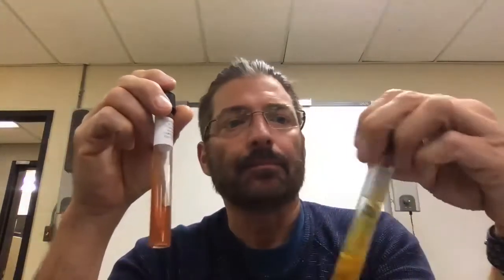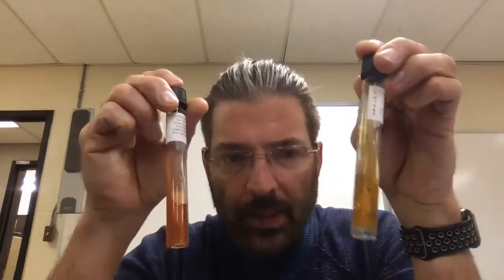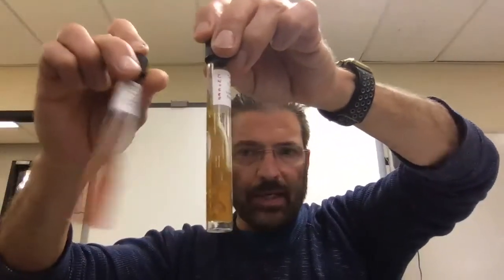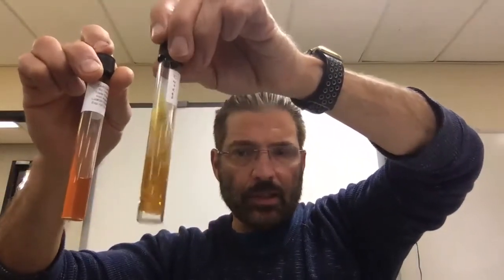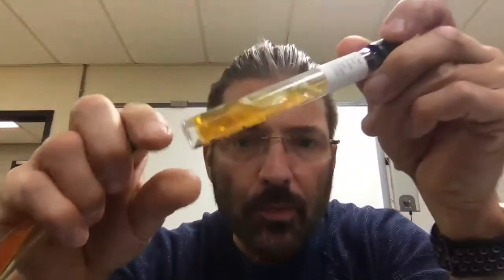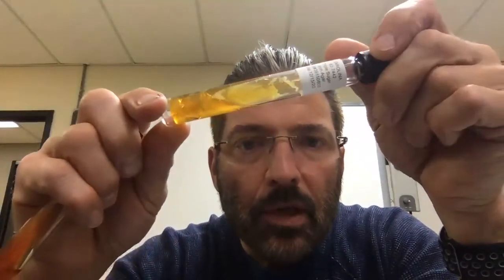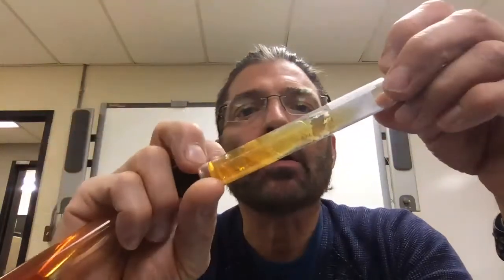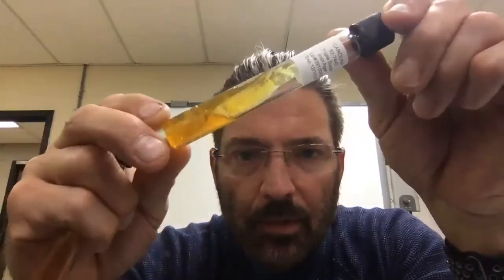But then again, here is triple sugar agar. This is the baseline, what it should look like. This is Enterobacteriaceae. Maybe I'll go against the white background. Baseline, Enterobacteriaceae. I'm going to try to zoom in on that. You can probably see all those white colonies growing on there. See that right there?